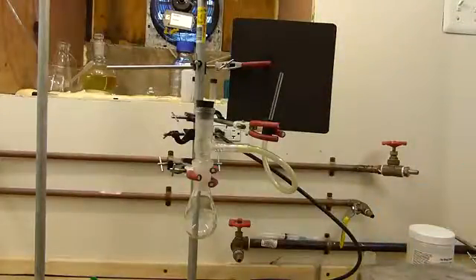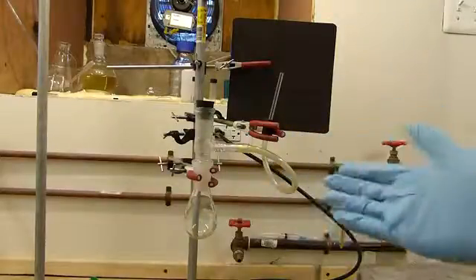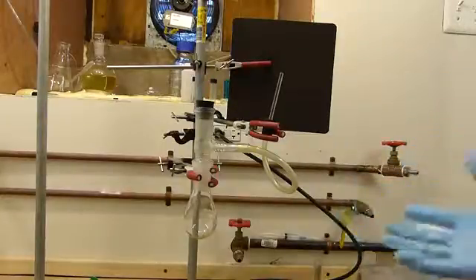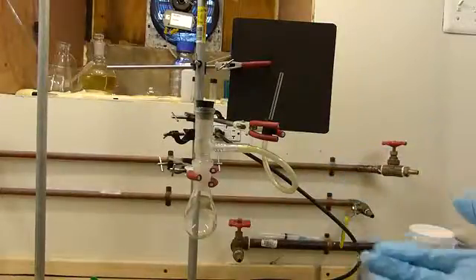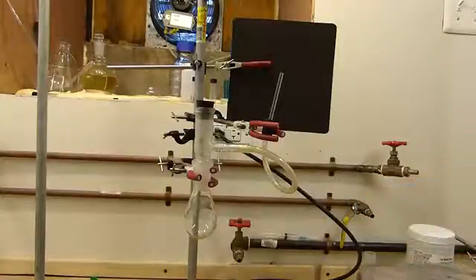However, in a laboratory setting you'd probably have some sort of gas drying train followed by an absorption unit for whatever you're using the carbon monoxide for, and then some scrubbers after that. This apparatus is designed to be explosion proof. Since carbon monoxide is flammable, it will explode in confined space when mixed with a sufficient amount of air.